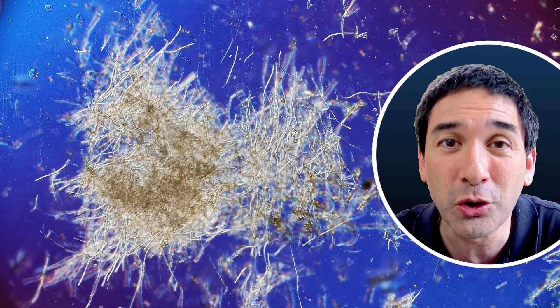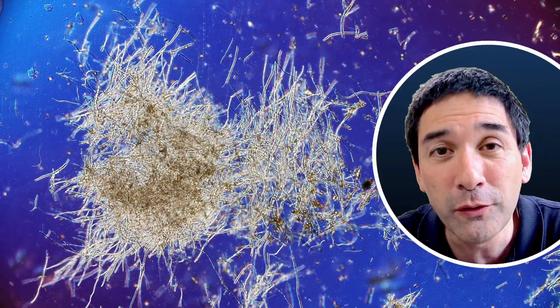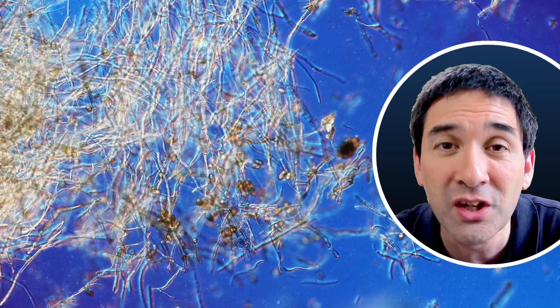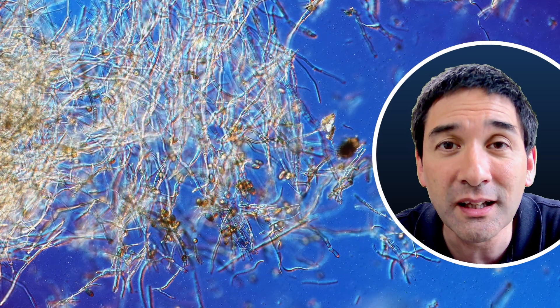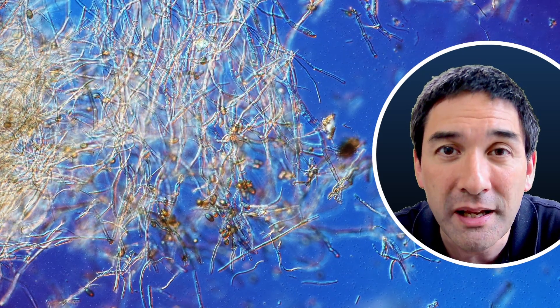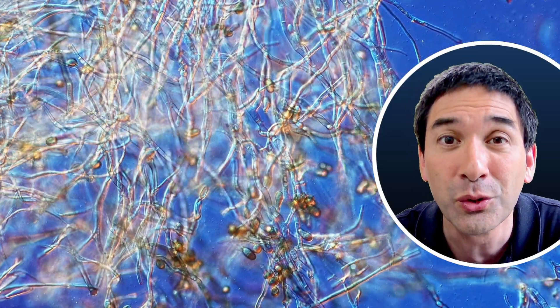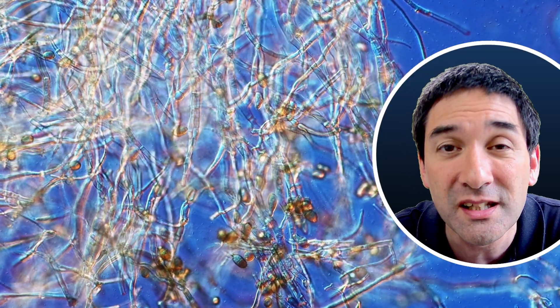Those long thin structures — these are the so-called hyphae of the fungus. The hyphae actually comprise the largest part of the fungus, and if you look very carefully between the hyphae you can also see some occasional round structures. These are the spores, which are reproductive structures that spread through the air, and when they settle down in a favorable place the spores will start to form a new fungus. New hyphae will grow out of those spores — this is basically how the mold is able to spread.